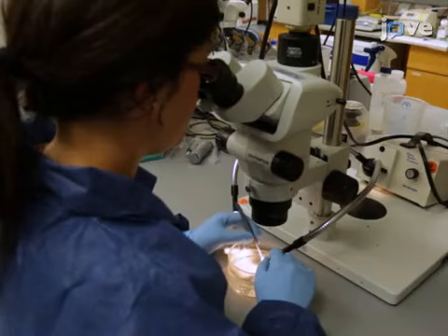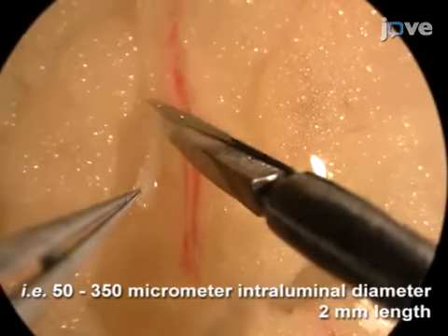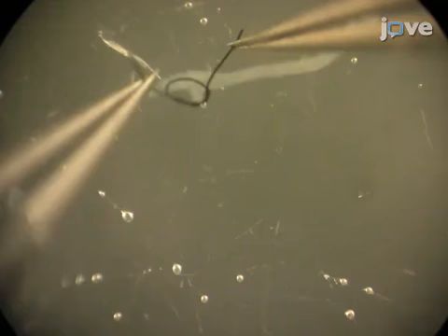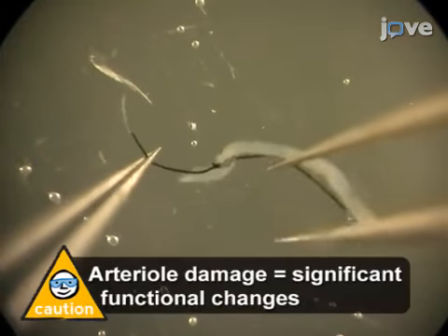Under a tissue dissecting microscope, use microscissors and microforceps to carefully remove the surrounding fat and connective tissue from the small arterioles within the adipose sample. It is essential to distinguish the arterioles from the venules. Arterioles are typically smaller in diameter, demonstrate a greater tone, and respond more robustly than do venules. When the arteriole has been isolated, use nylon or silk sutures to tie off any branches.